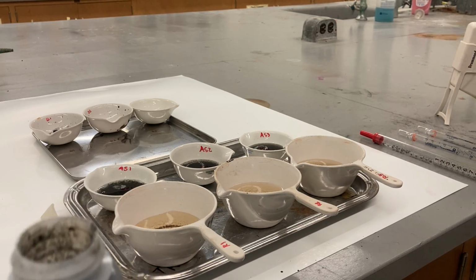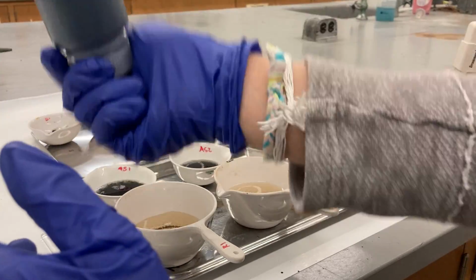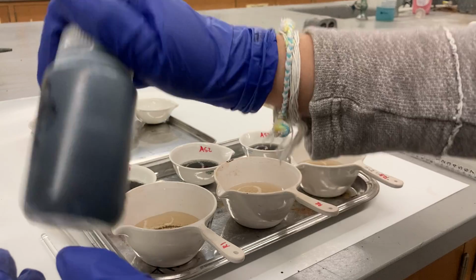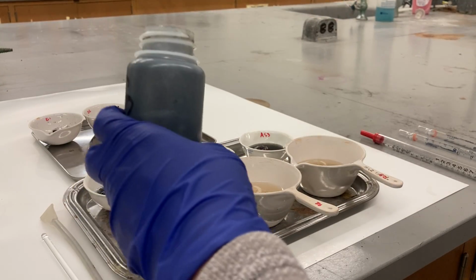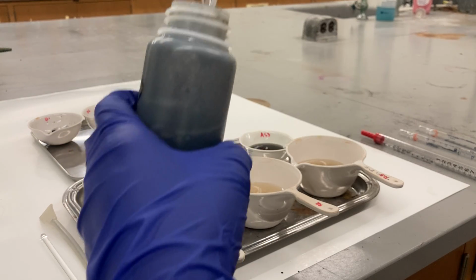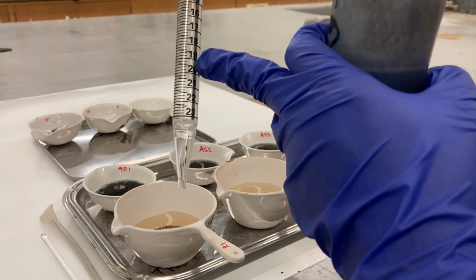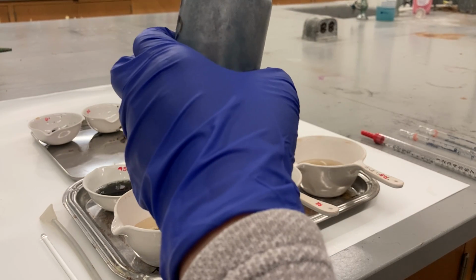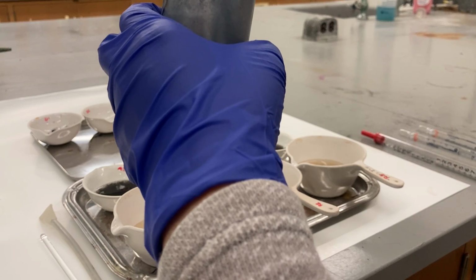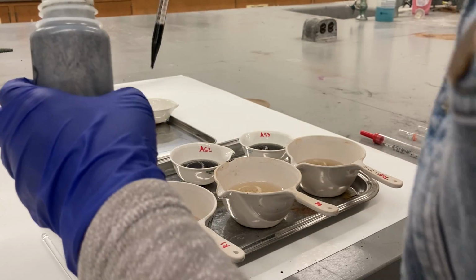Check it one more time. Even though you checked it, if you went to do something else, you have to invert it to make sure you get a homogeneous sample, all the time. This one is gonna be 5. We're gonna pipette until 20 right over here. It's black, so it's difficult to read.